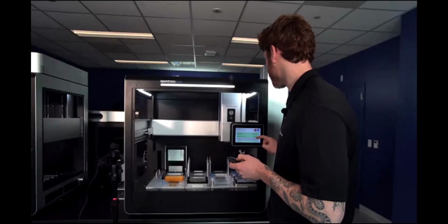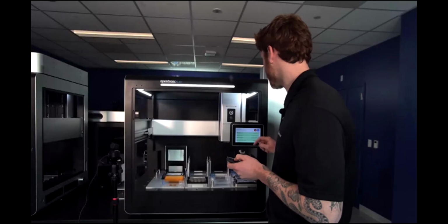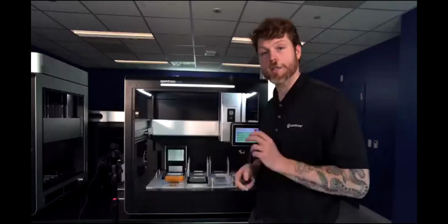Okay, let me just confirm these offsets again. Okay, pressing go.